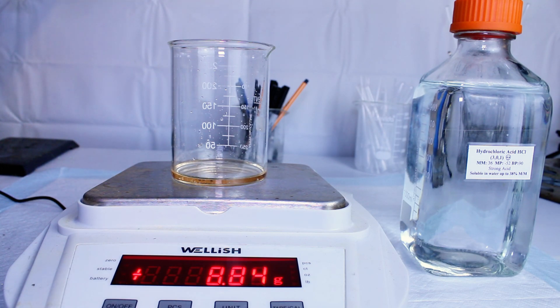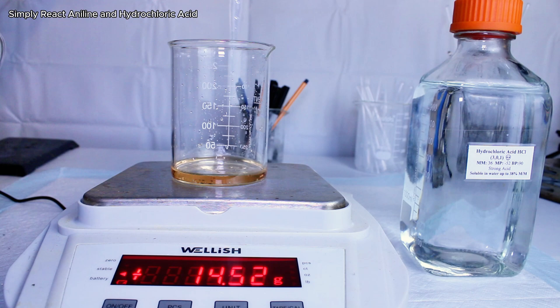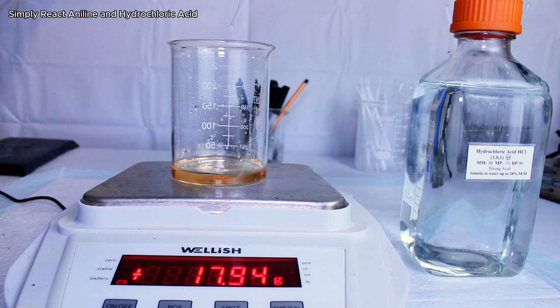This specific process is fairly easy, and all you really have to do is react molar equivalents of aniline and hydrochloric acid and boil the resulting solution to dryness.